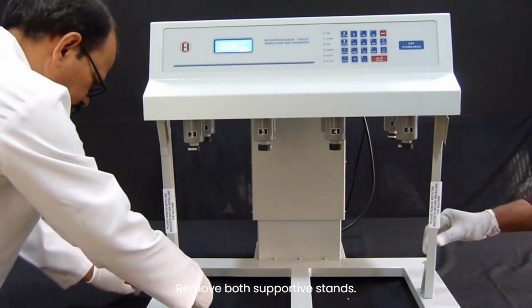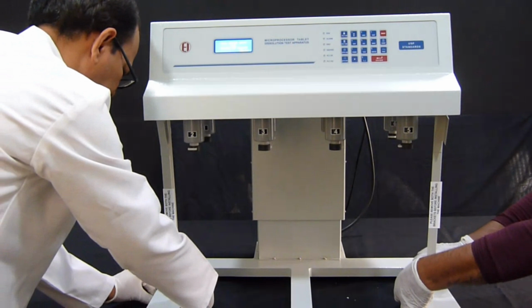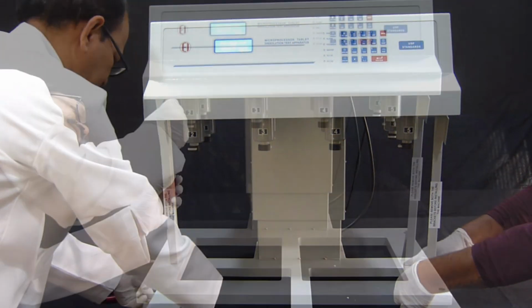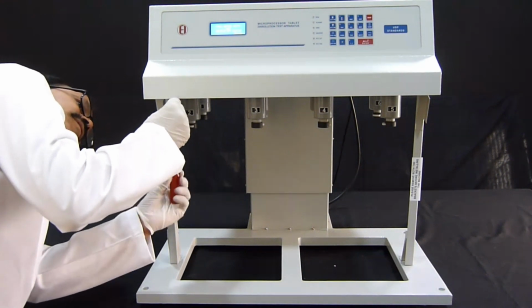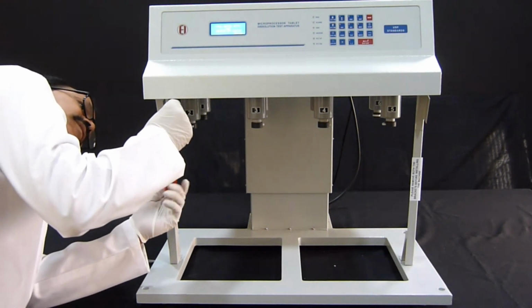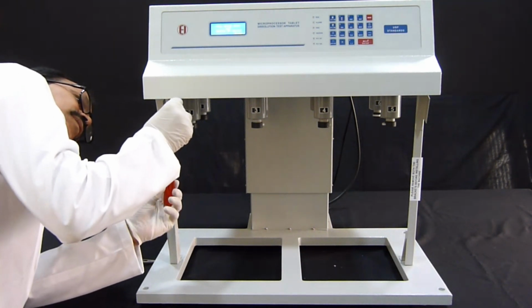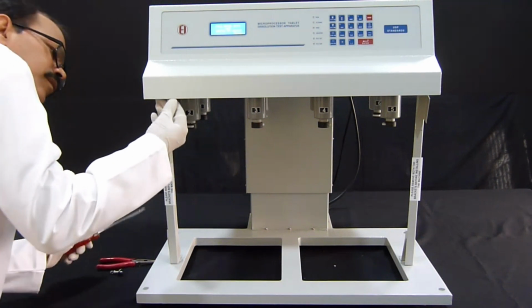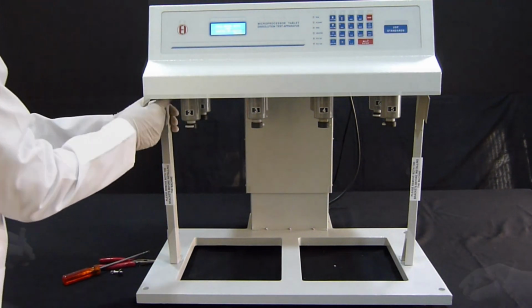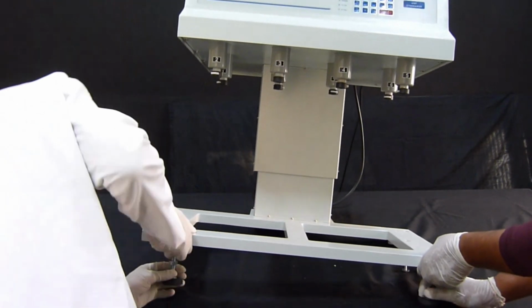Remove both supportive stands. Place the footrest at the bottom of the instrument.